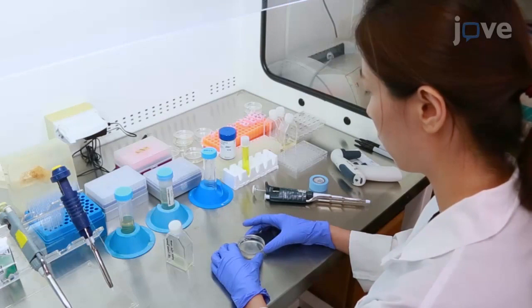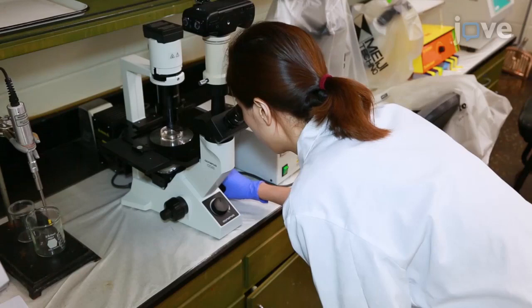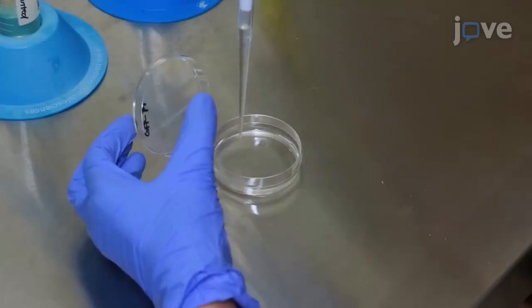Then remove the cell culture medium and replace it with 2 mL of Grace's insect medium. After this, prepare transfection mixture A and B solutions according to the text protocol.